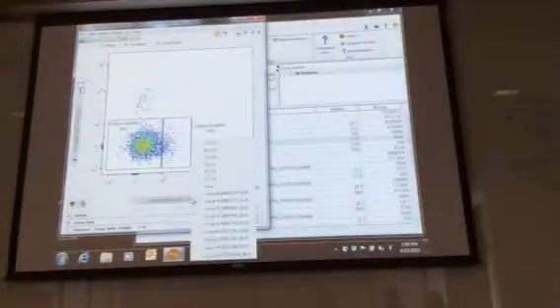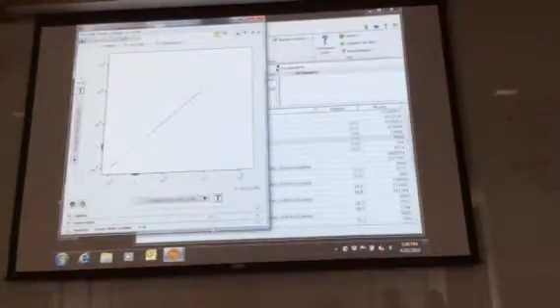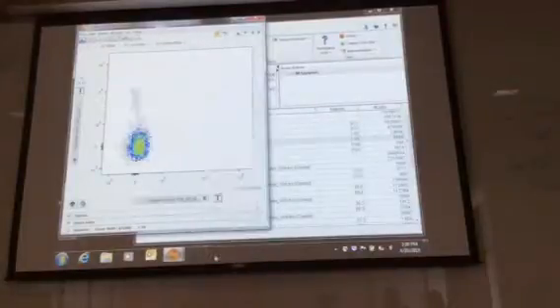But I don't know what it's supposed to look like. So, in general, let me, it's all compensated. Fairly well.